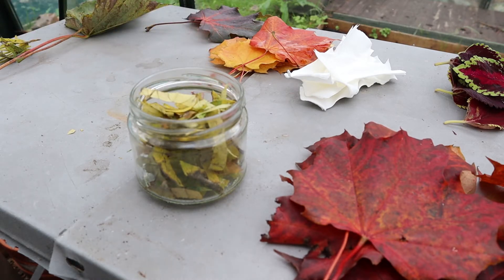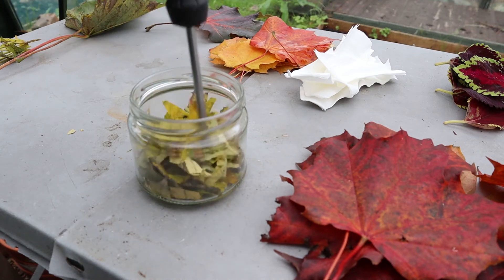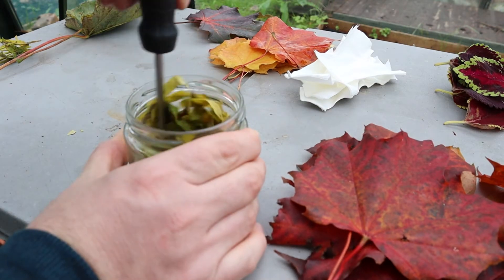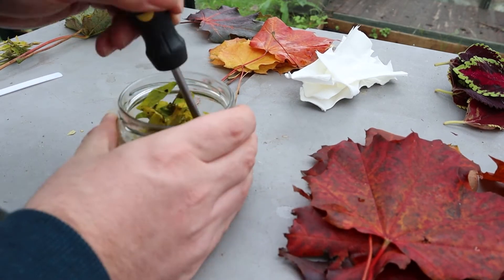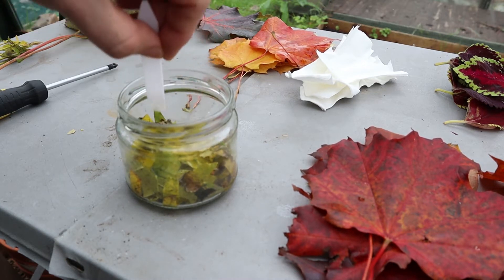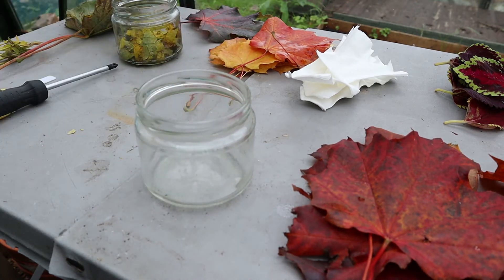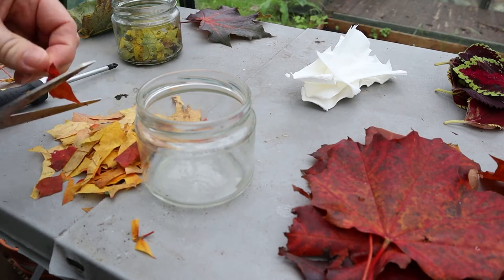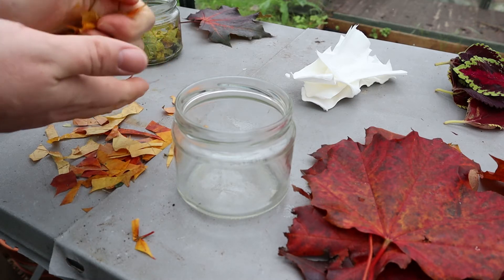Then I'm just going to use something to crush them down into the jar. All I've got is a screwdriver, so I'm going to use that as a crushing stick and really mush all these up — you want to get them really well crushed. That's just going to take a couple of minutes. Get them all squashed right down in the bottom so they're in contact with the acetone. Then I'll move on to the next jar and do the same with the orange ones. Give them a good crushing in your hands as well, really scrunch them up, and then stick them in your jar.